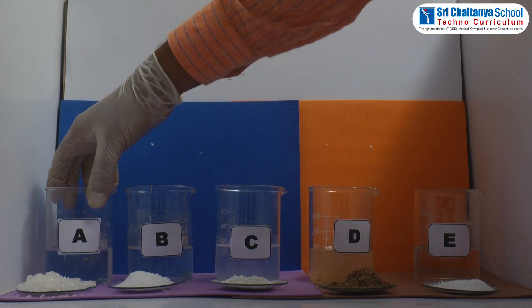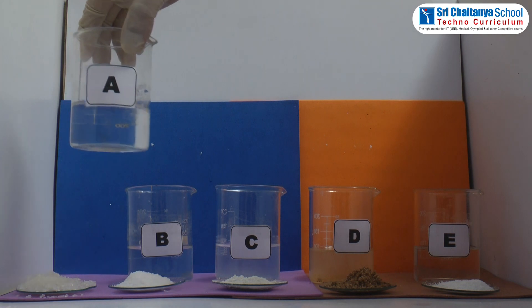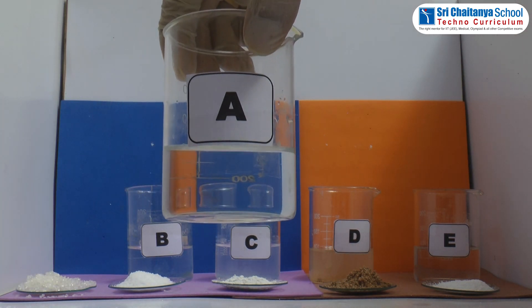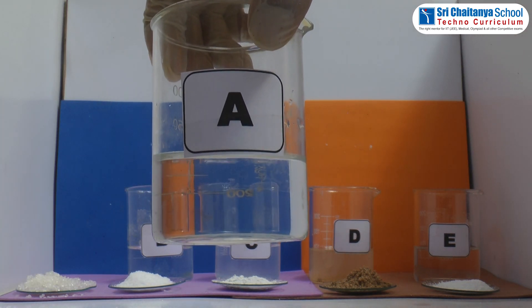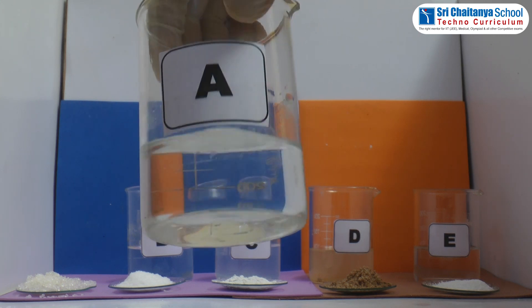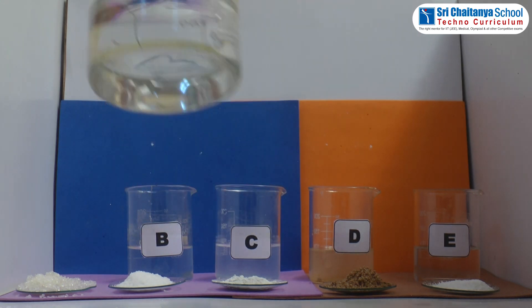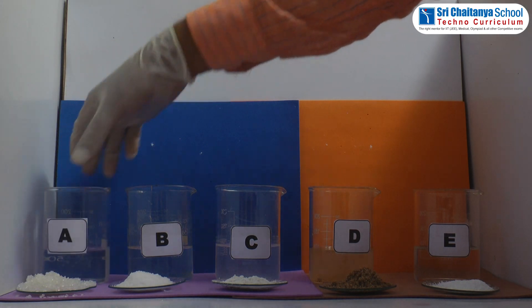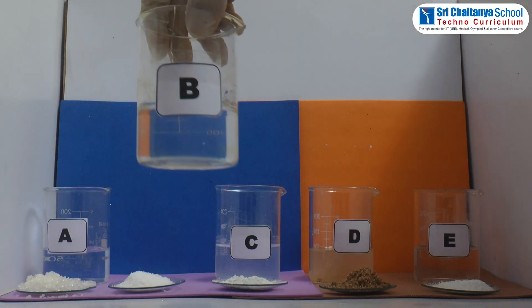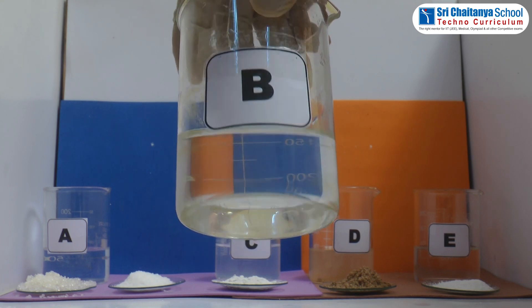Now we will go for observation. In beaker A, sugar is soluble in water because sugar disappears completely in water. In beaker B, salt is soluble as it disappears completely in water.